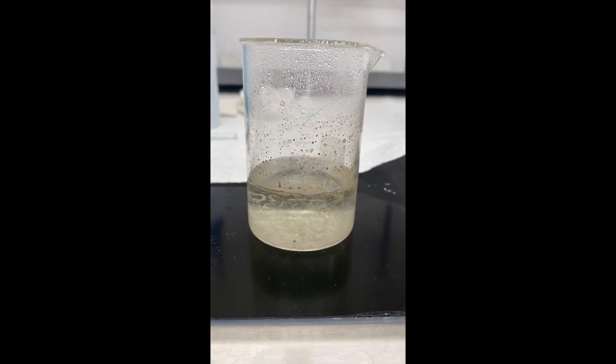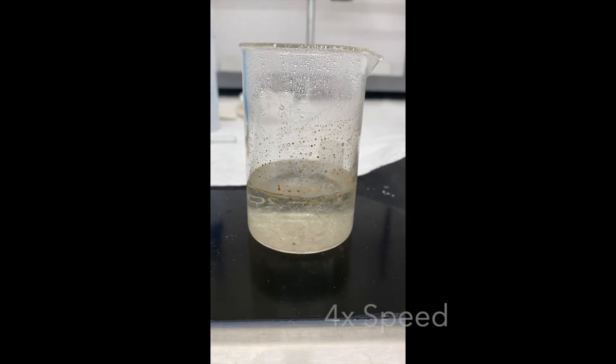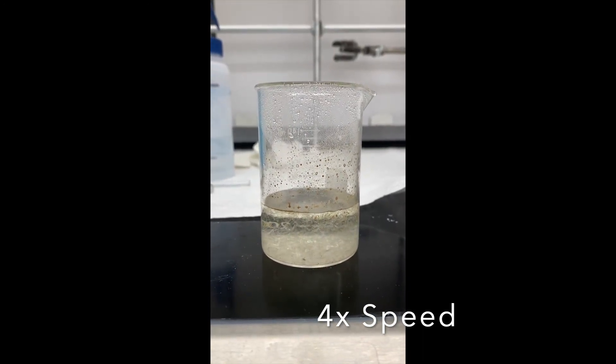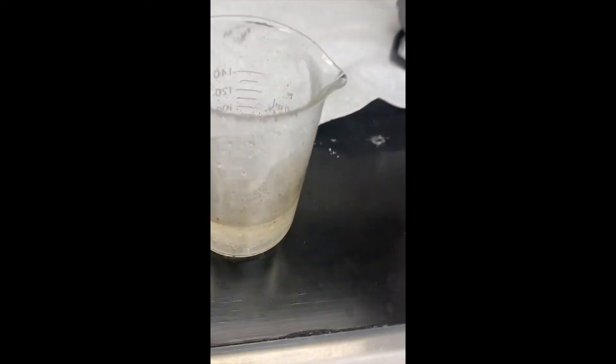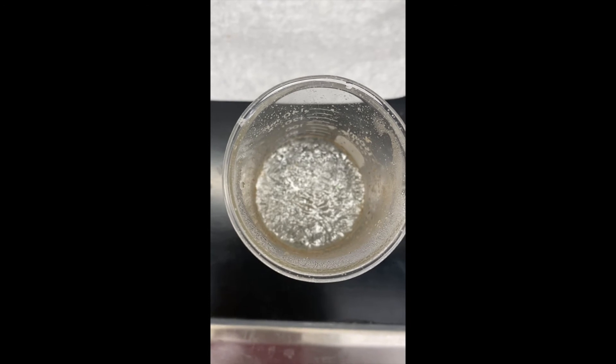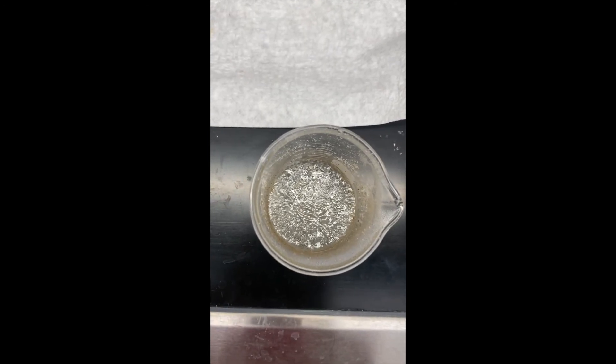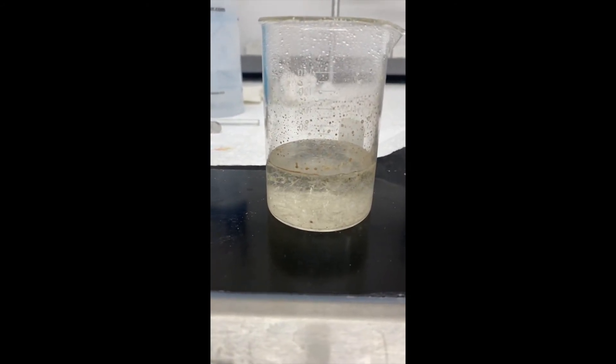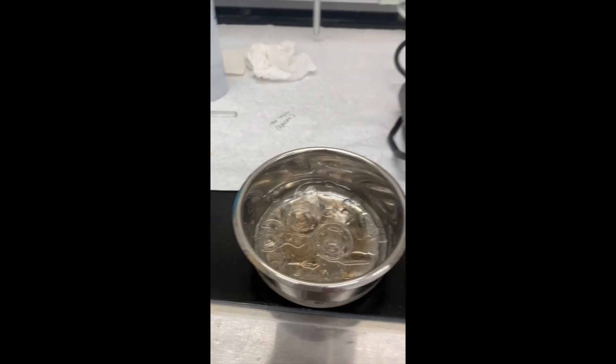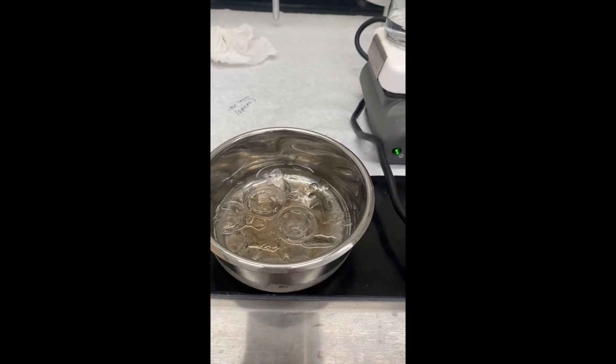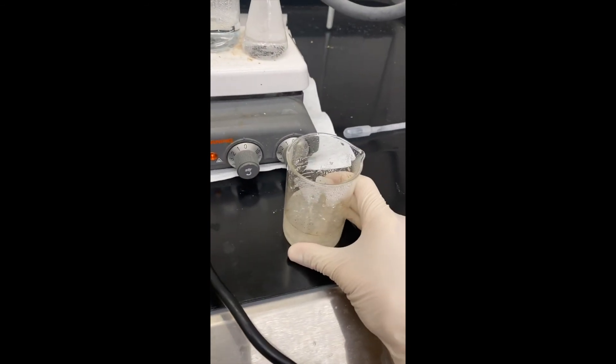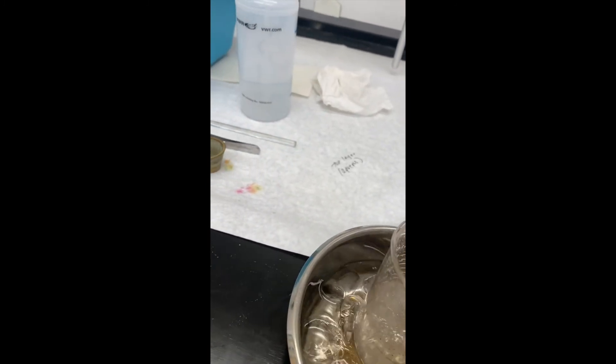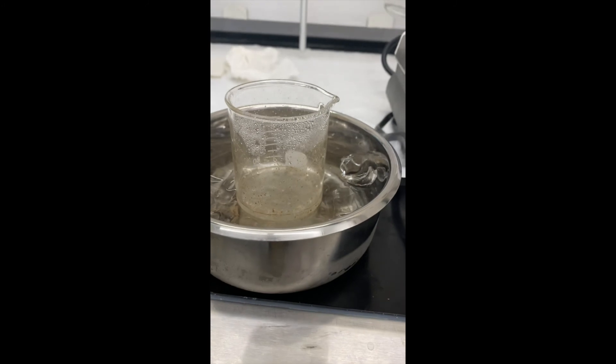So here I've just set up a little ice bath. I've got some ice cubes and some water. And now that my solution with the crystals has cooled to about room temperature, it's now ready to be cooled further so that we can even increase the amount of crystals that crash out of solution.